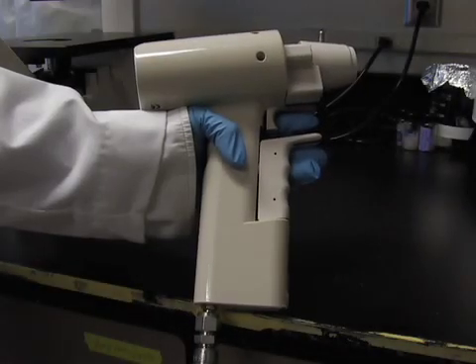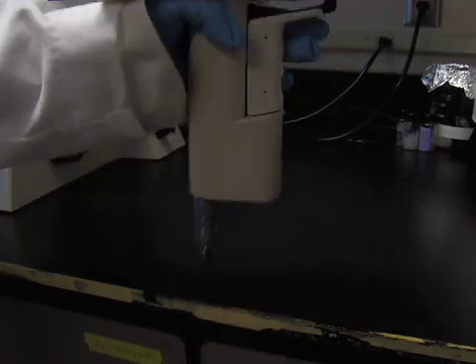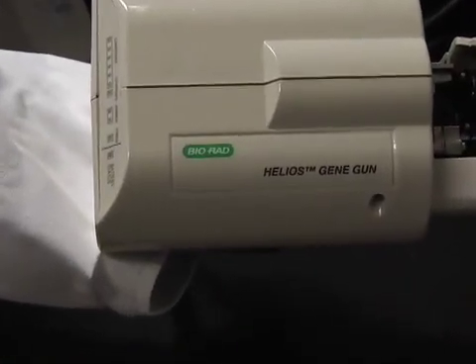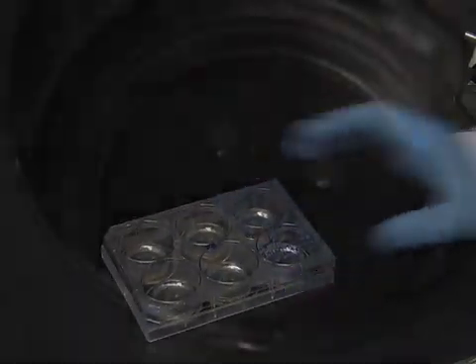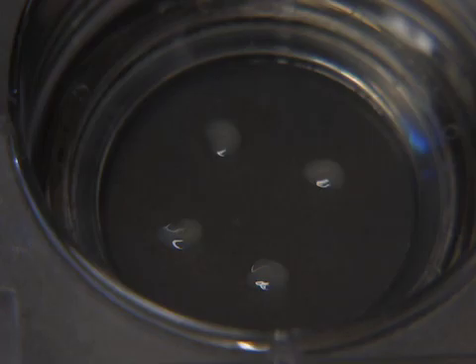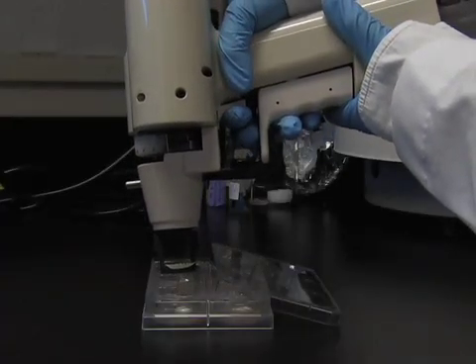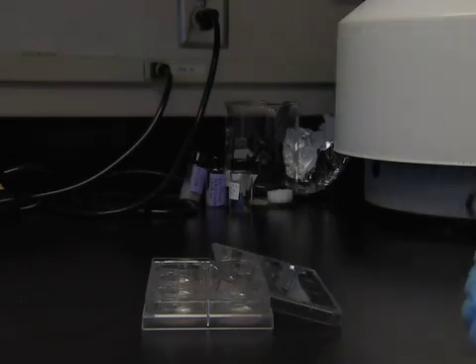Now that the bullets are made, I am ready to actually biolistically transfect cells. I will be using a Bio-Rad Helios gene gun and will be shooting rat hippocampus slices that have been incubated for 5 days since they were dissected. The gene gun will be connected to a helium gas tank. When the gun is fired, a short burst of pressure from the tank will accelerate the gold particles at the slice.